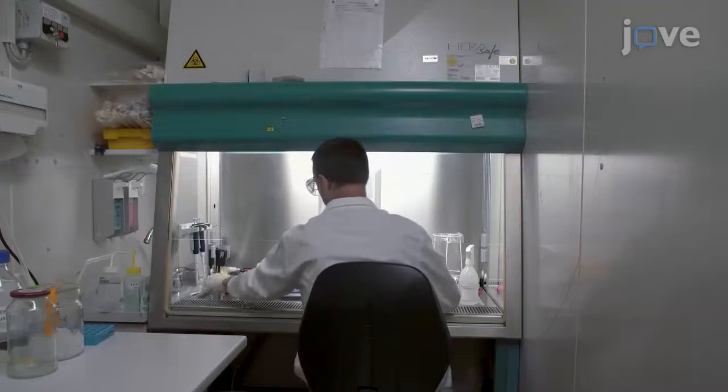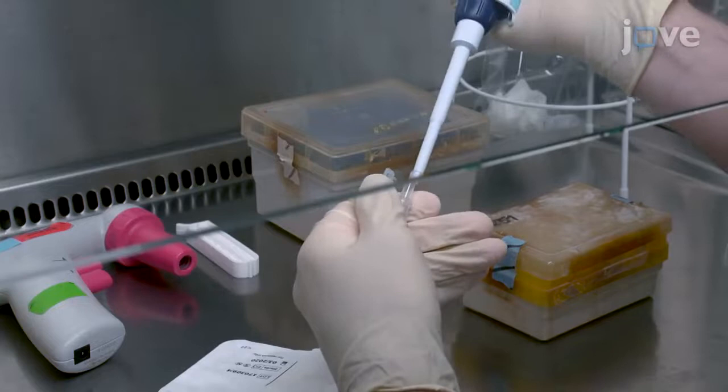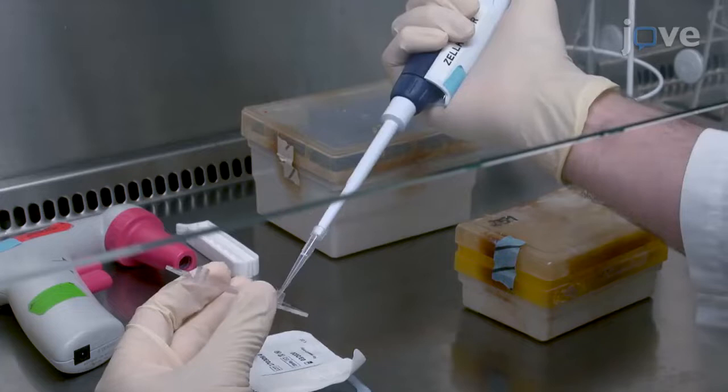To begin, work in a sterile environment using a clean bench. Use a pipette to inject 100 microliters of a 2% sterile filtered porcine gelatin PBS solution into a single reservoir of a temperature equilibrated channel slide.